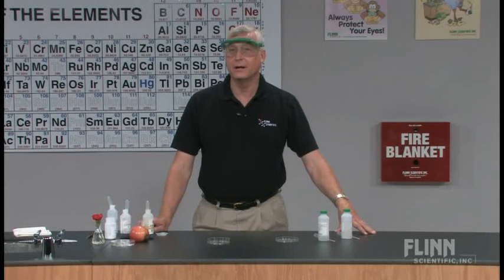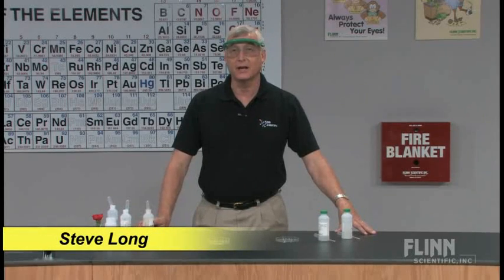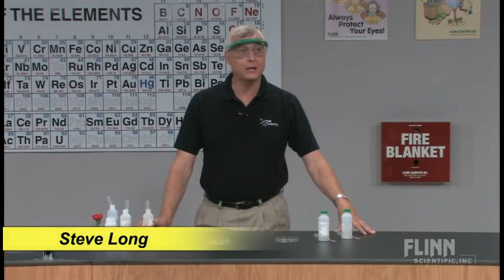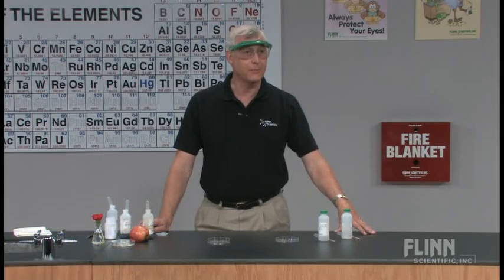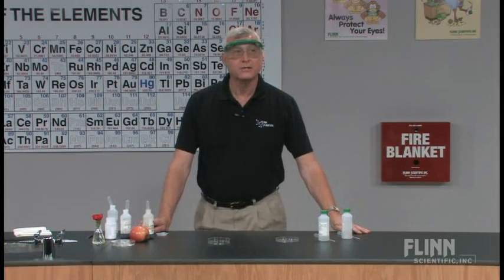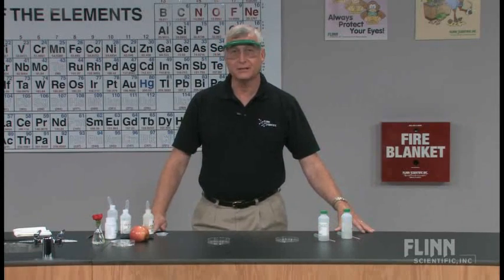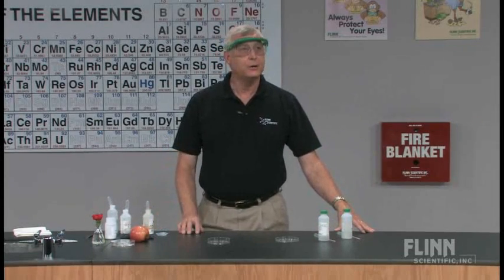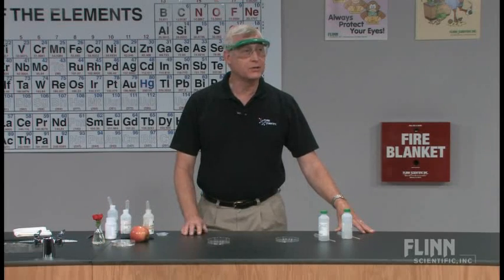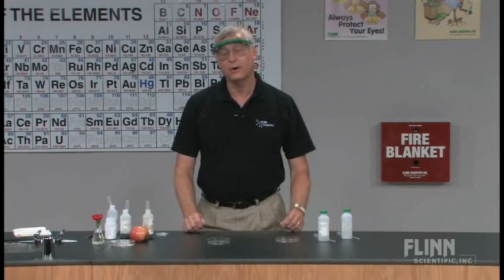Acid rain is a topic that's in our news and in our lives a lot these days, and students don't often understand exactly what acid rain is all about. They've heard the term but they really don't understand. So when we're talking about acid rain and talking about acids and bases, I do a small scale acid rain lab that allows the students to try to relate to what's going on with that.